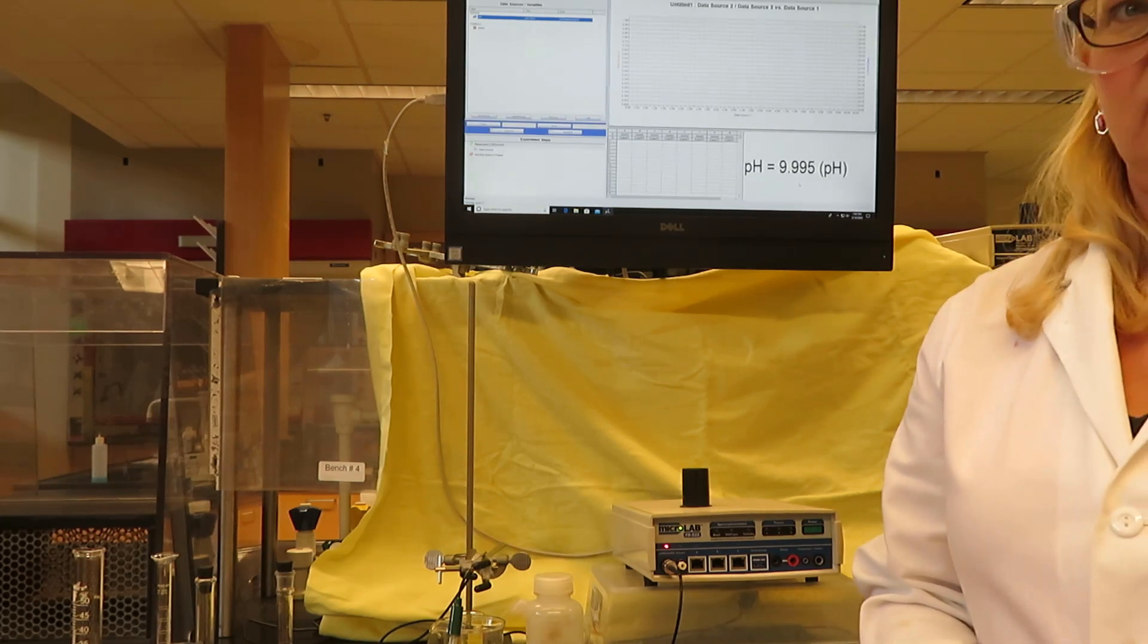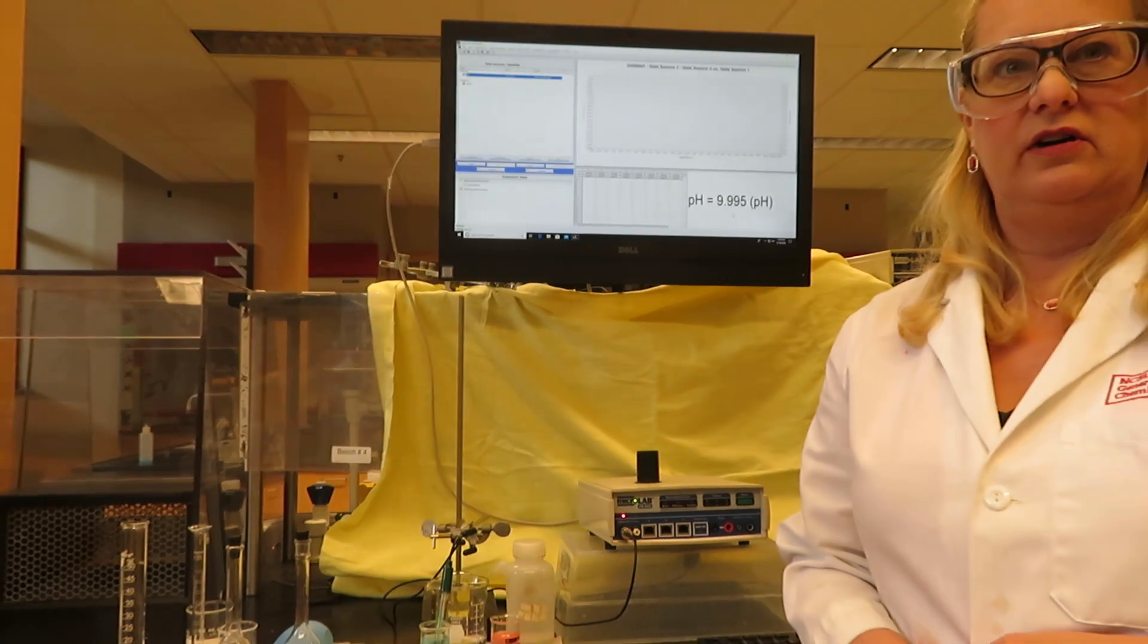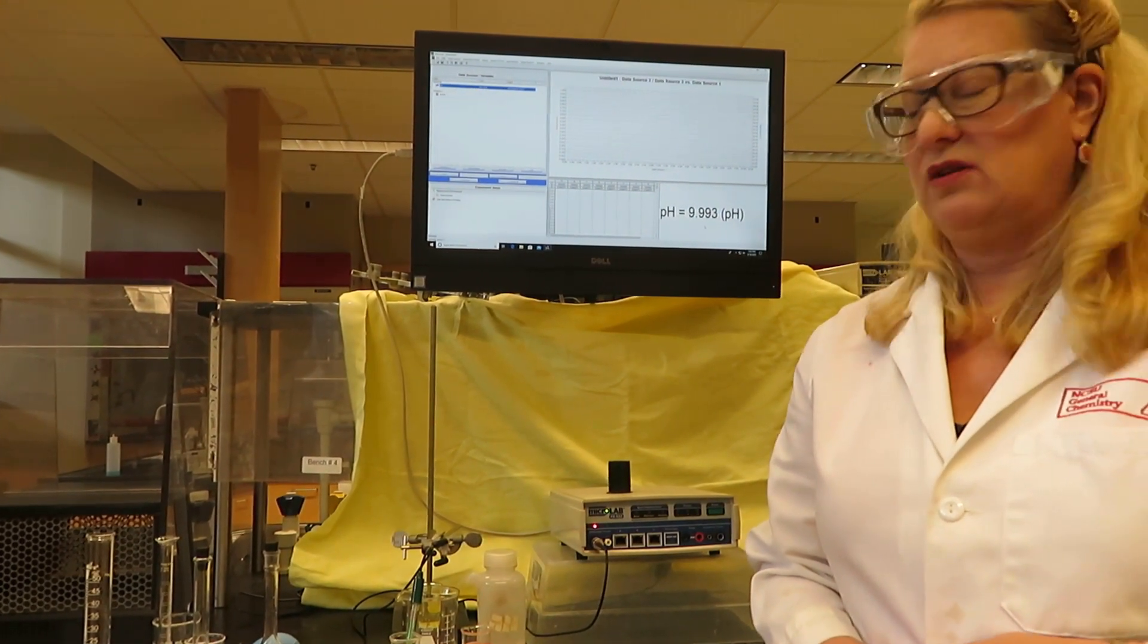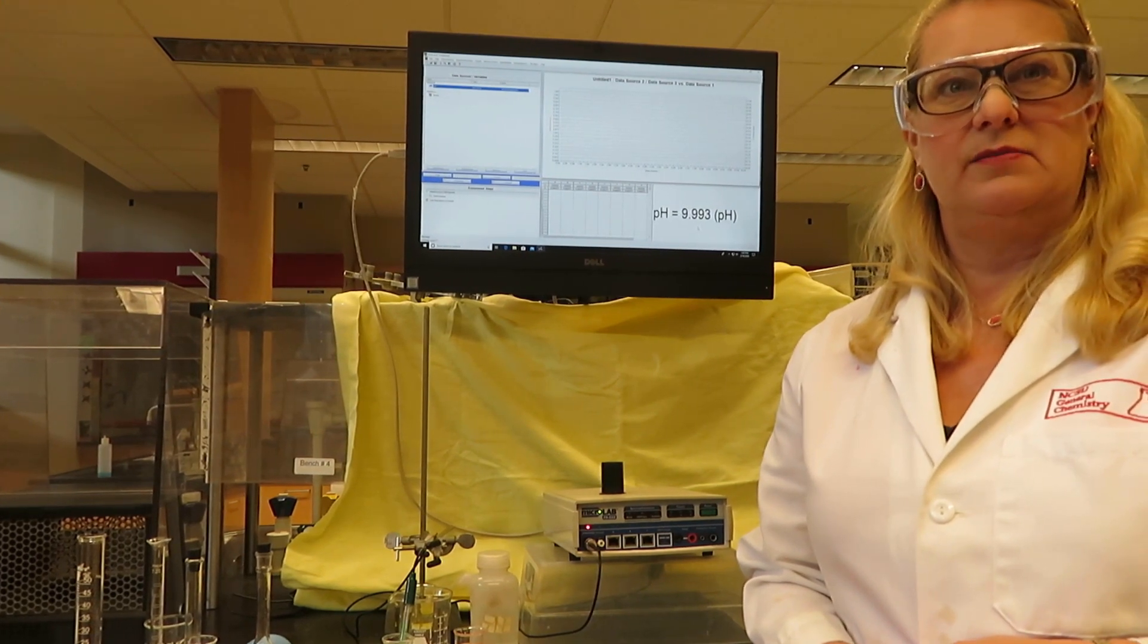So now we know that we've done a good job calibrating our pH probe, and we can go on with the next part of our experiment. Thank you.